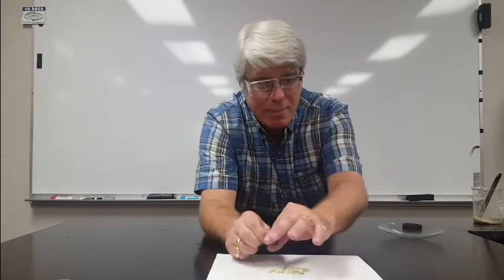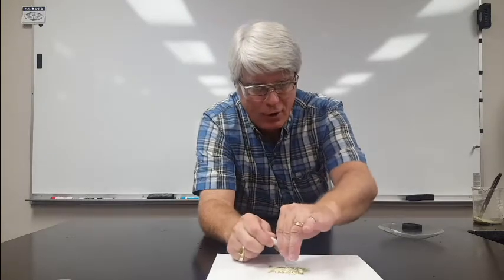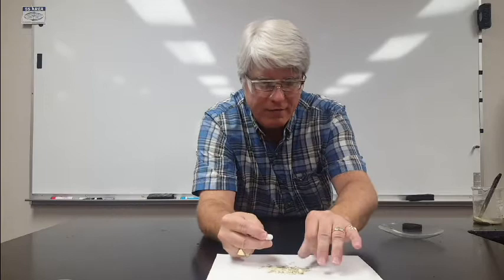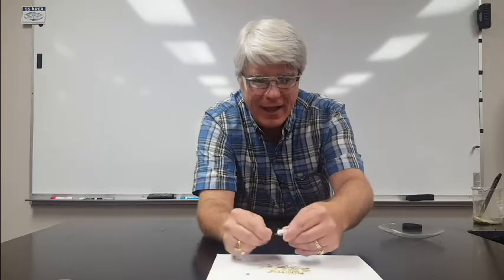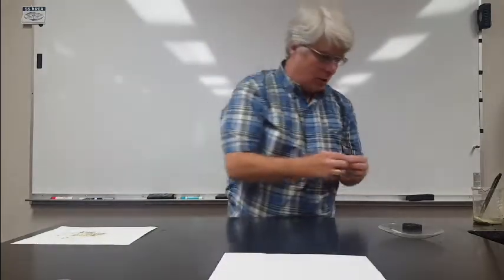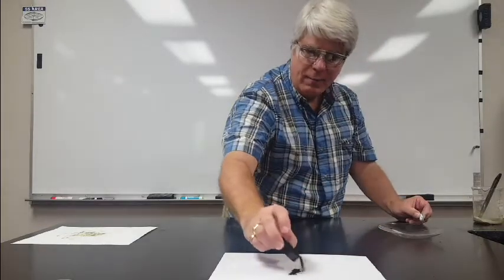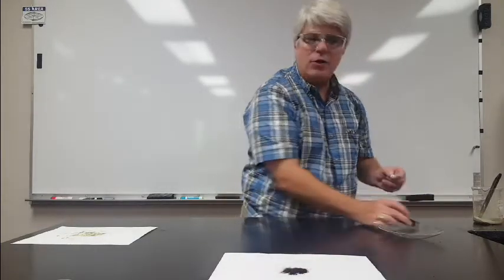That's what tells you this is a mixture. Now, if I get most of the iron off this — it's a real nuisance to try and get all the iron off it, but I'll get most of it anyway. This other substance also contains iron and sulfur, but it's a pure substance. It's iron sulfide.